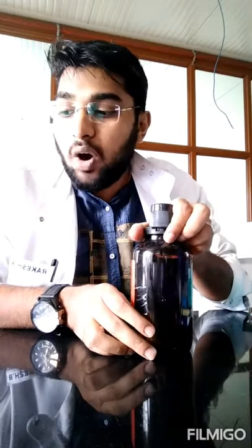To prepare the phosphomolybdenum reagent, you need three chemicals. First is sodium phosphate — it can be dibasic or monobasic depending on availability. We need 28 millimolar sodium phosphate. Second is ammonium molybdate — we require 4 millimolar. Note that tetrahydrate means 4 water molecules are attached, so the molecular weight depends on the number of hydrate molecules. Calculate 4 millimolar based on the molecular weight on your reagent bottle.